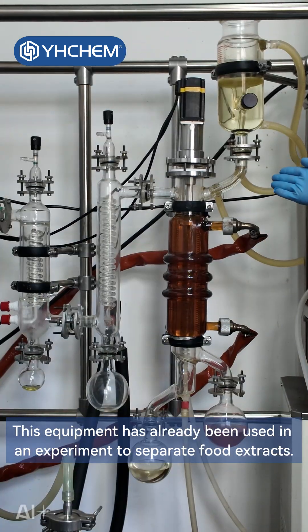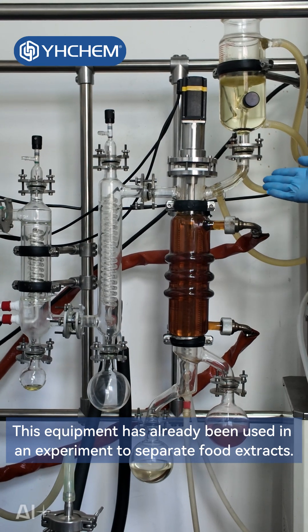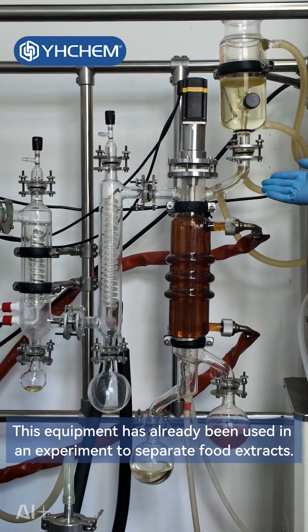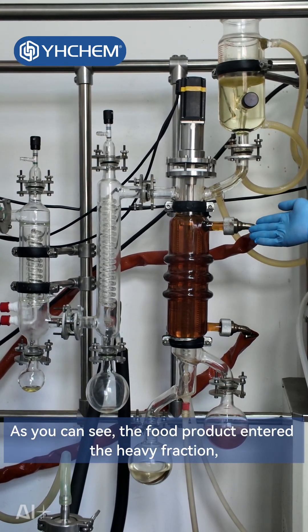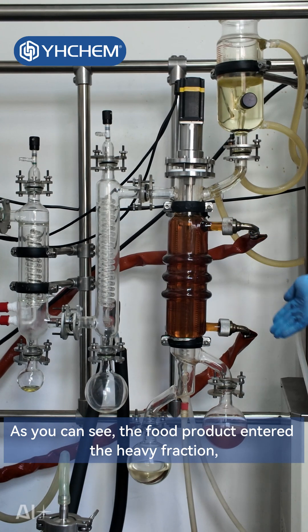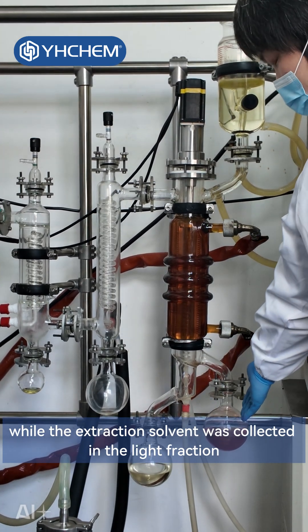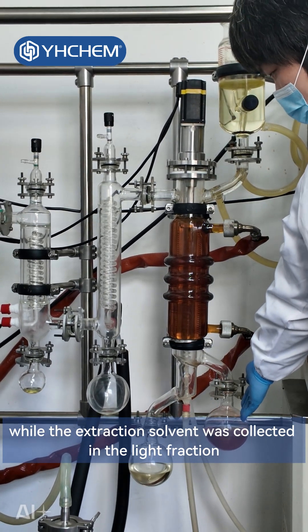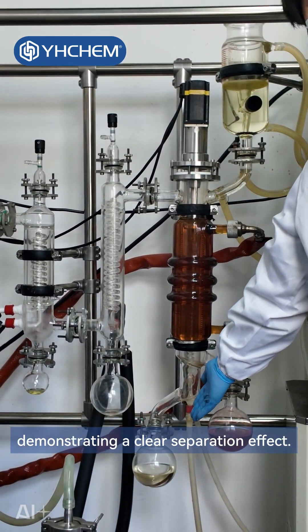This equipment has already been used in an experiment to separate food extracts. As you can see, the food product entered the heavy fraction while the extraction solvent was collected in the light fraction, demonstrating a clear separation effect.